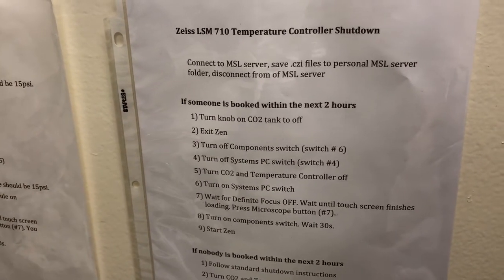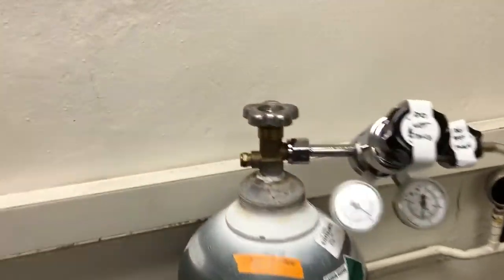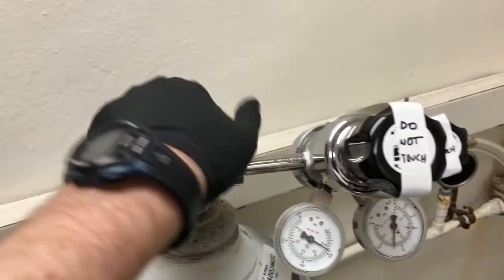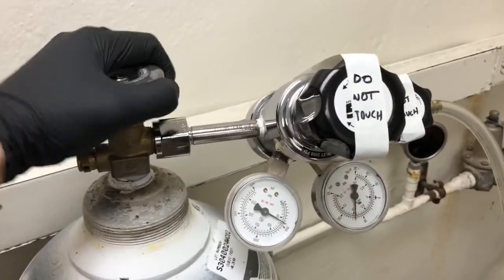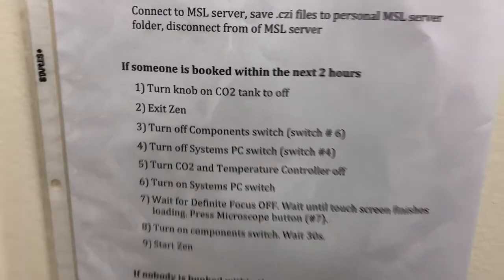So let's follow the instructions. First step is to turn the knob on the CO2 tank to off. So if you recall, this is the CO2 tank. Turning it clockwise turns this off. There we go. This will take some time to go down. All right, so what's next? I want to exit Zen.